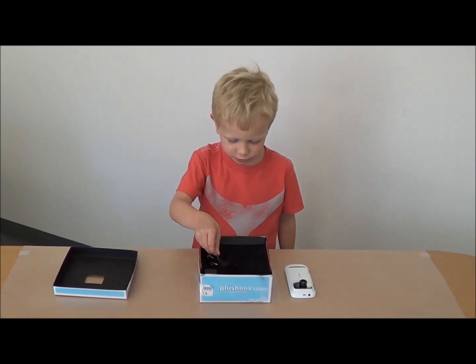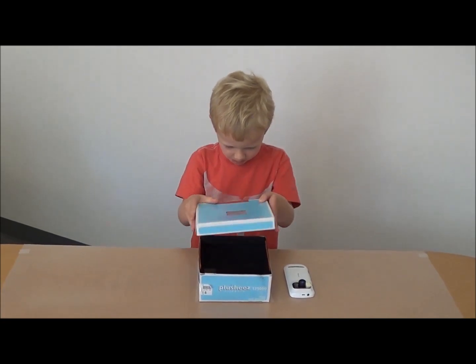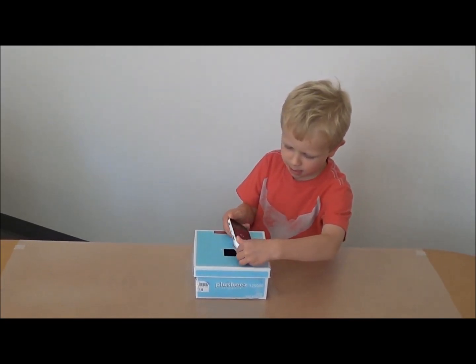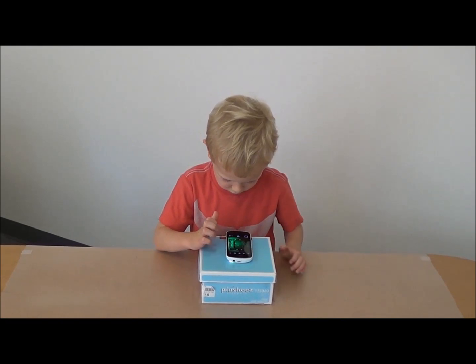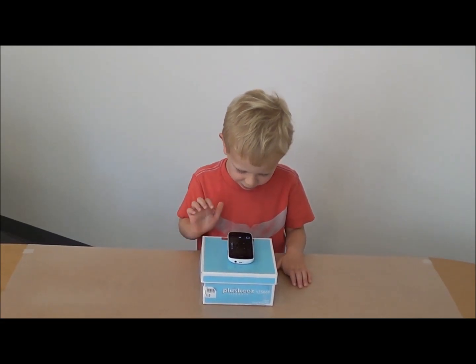Take the chip and put it into a shoebox. Cover it up. Then you put the phone on top. Tap the screen. Then you take a picture.